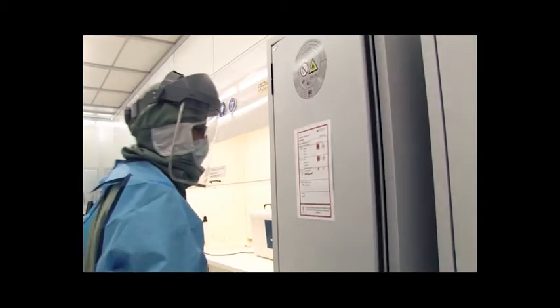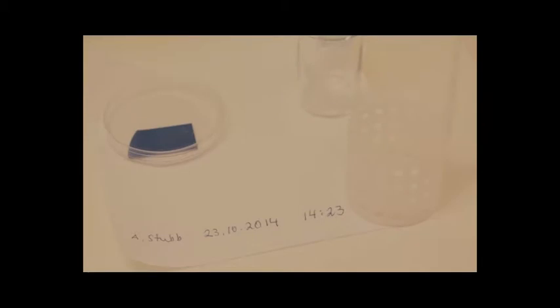Fume hoods and wet benches are not to be used for storage. Sometimes you may have to leave your samples and beakers in a fume hood, for instance if your sample requires a long treatment in a chemical bath. Place your items in a suitable corner of the fume hood so others can use the fume hood while you are away.